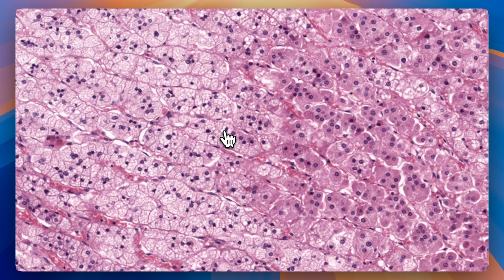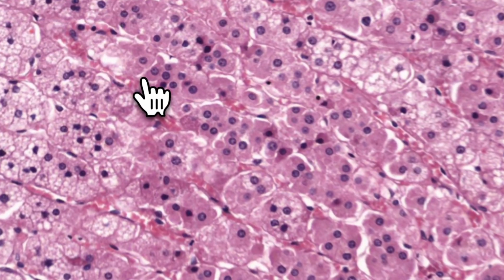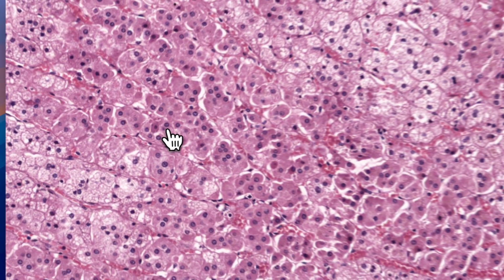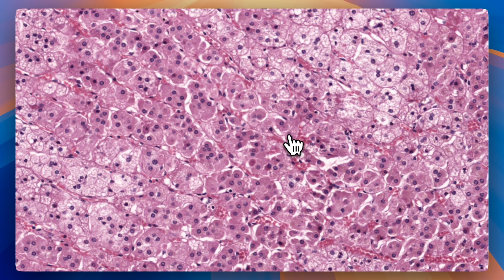Now, there's quite a sharp delineation here between the zona fasciculata and the deepest cortical area, which is the zona reticularis. You'll notice that the cells get smaller, first of all, and the rows of cells will actually start to anastomose. So they start to join and merge, as you can see here. And they form these little gossip circles, or these networks, right? Makes perfect sense, since with zona reticularis, you think reticulum, which means network, right?